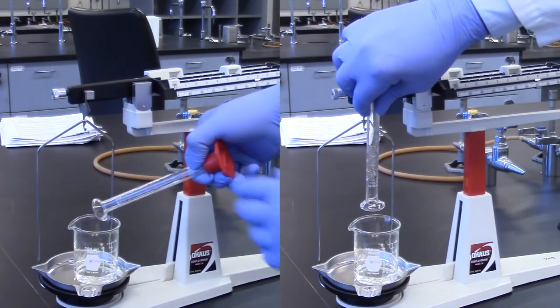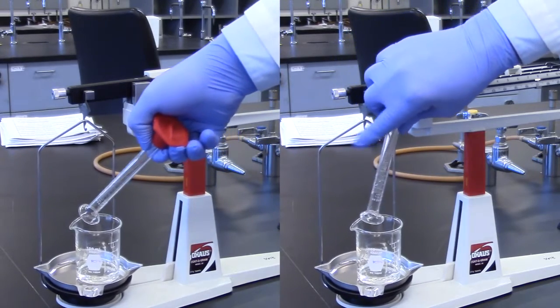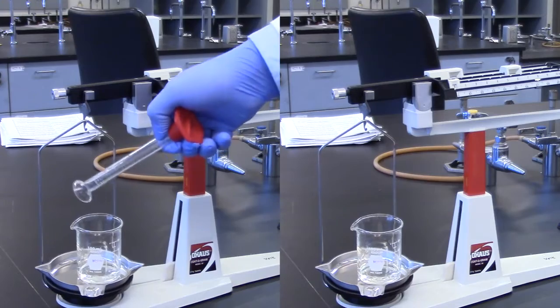Again, you and your partner should decide on how long to hold the 10 milliliter graduated cylinder upside down over the 100 milliliter beaker.